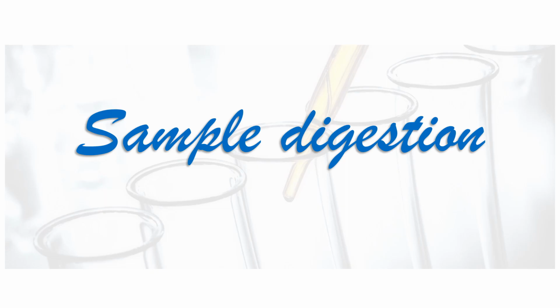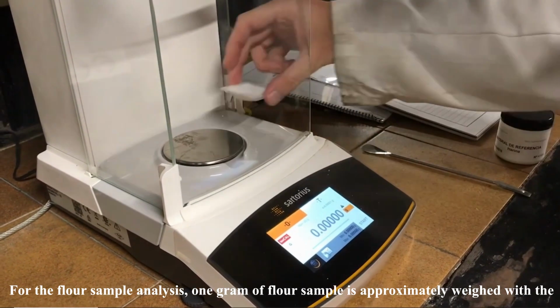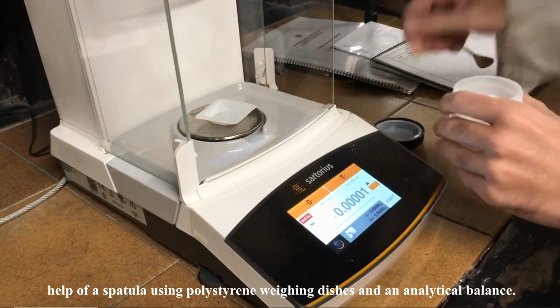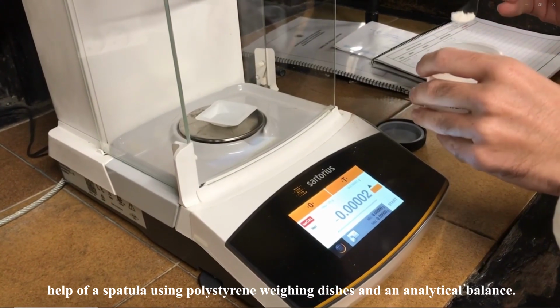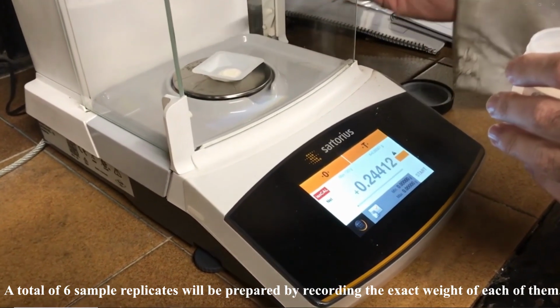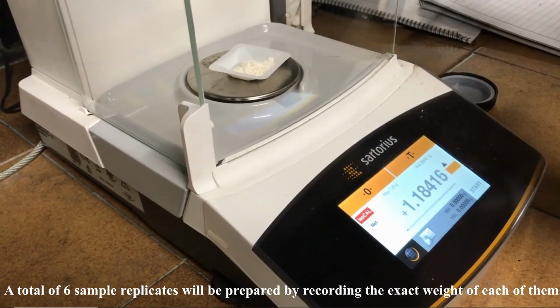Sample digestion. For the flour sample analysis, 1 gram of flour sample is approximately weighed with the help of a spatula using polystyrene weighing boats and an analytical balance. A total of 6 sample replicates will be prepared by recording the exact weight of each of them.